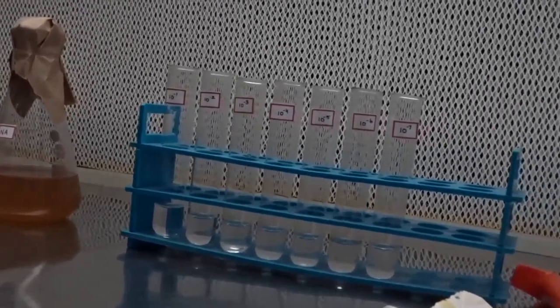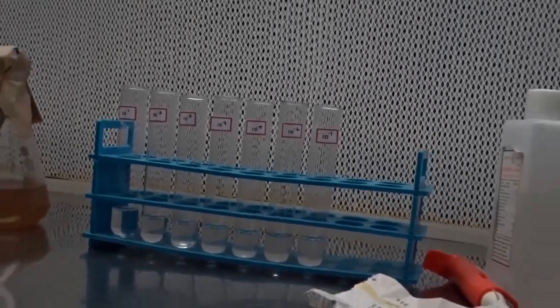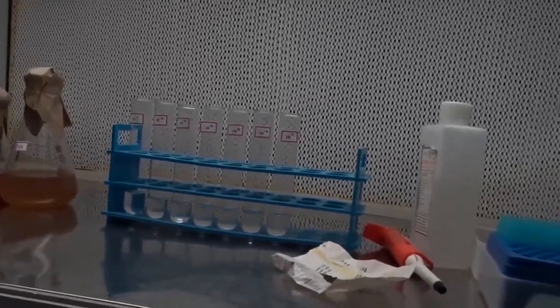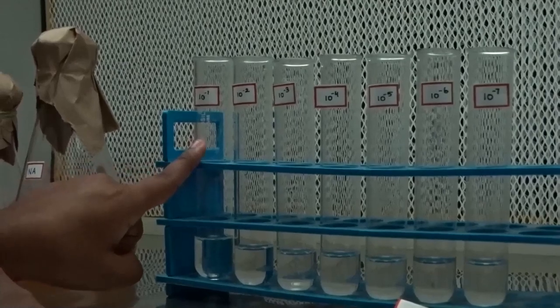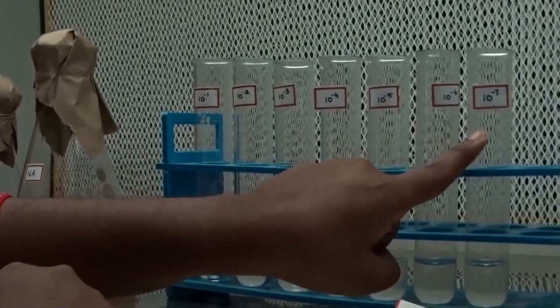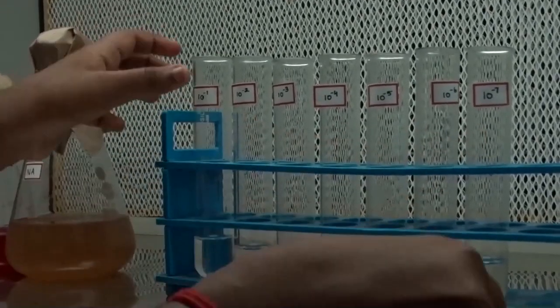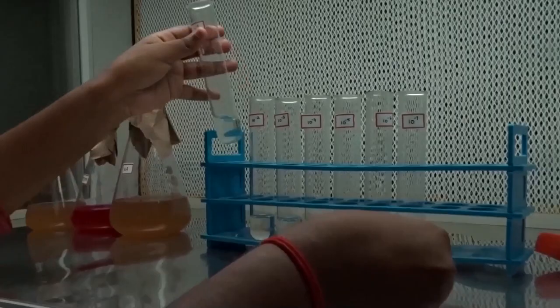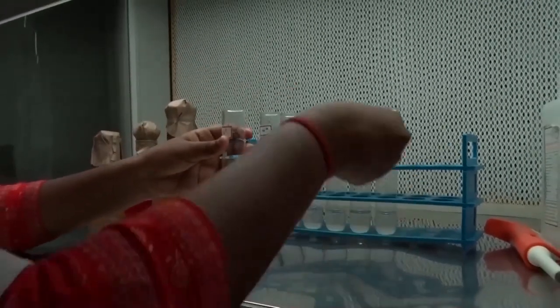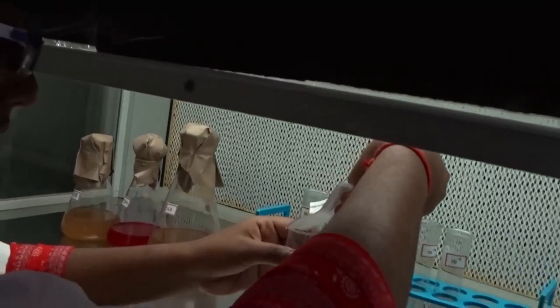Prepare dilutions up to 10 to the power minus 7 using sterile distilled water. These are the various dilutions. Take 1 gram of soil sample and dissolve in 10 ml of sterile distilled water.